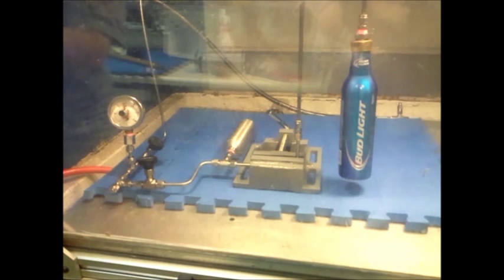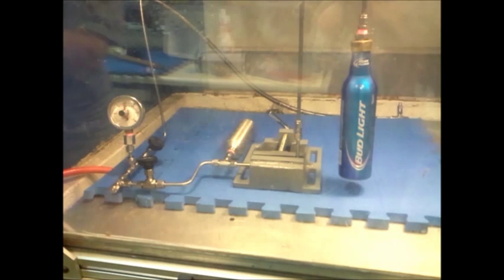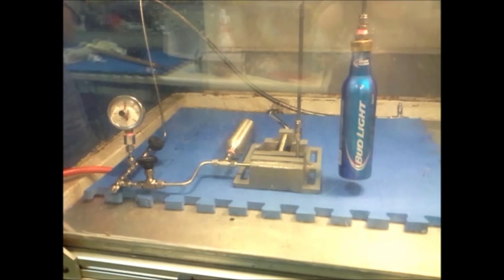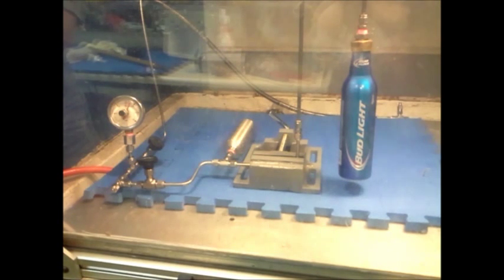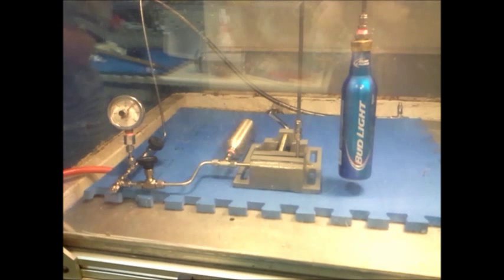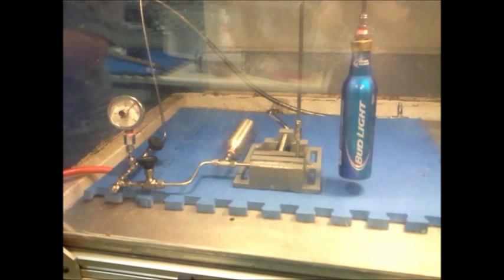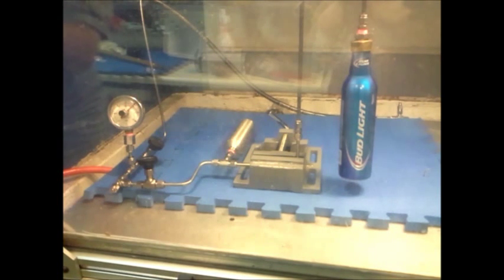Nearly 200, nearly 150, we're up to 200.